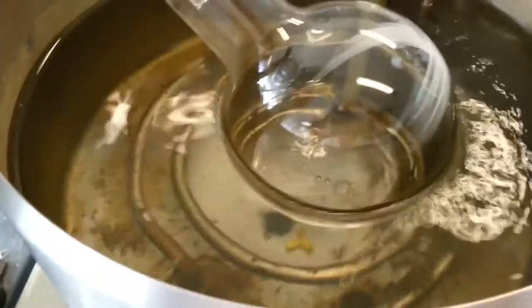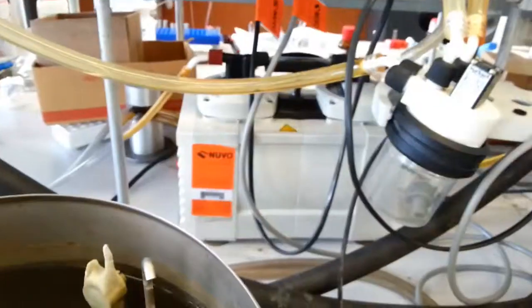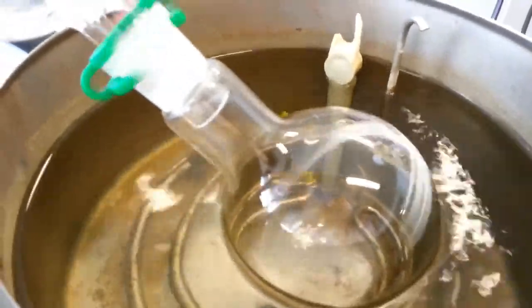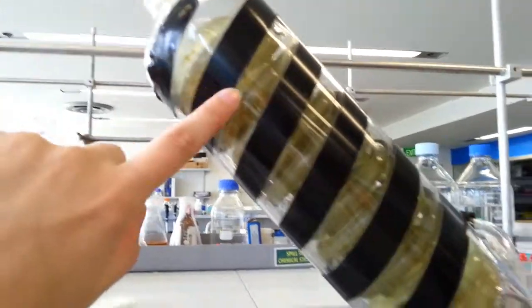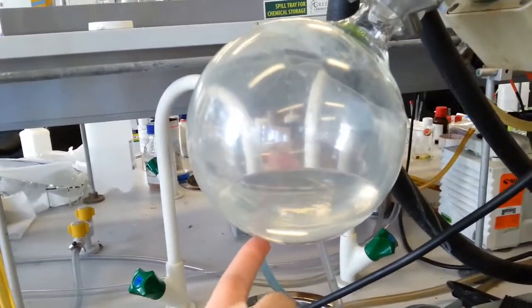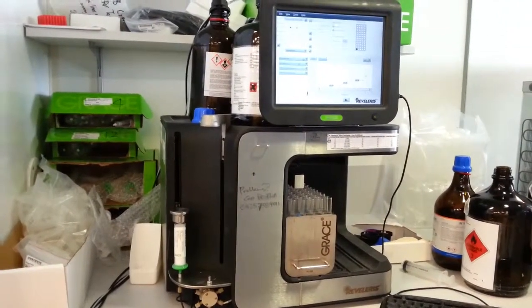The flask with your compound dissolved in a solution is immersed in a water bath, usually set at about 40 degrees Celsius, and there's a vacuum attached to it which pulls a vacuum on the whole system, lowering the pressure so that the solvent boils off at lower temperatures. So at 40 degrees Celsius you can remove solvents that would usually only boil at much higher temperatures. So the solvents boil out of the flask, move through the glassware and end up here. In here is a glass coil through which is run a liquid that is kept at a low temperature, and it causes all the solvent vapors to condense and collect into this flask here, which you can then throw in the waste.